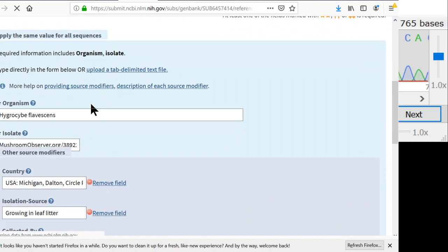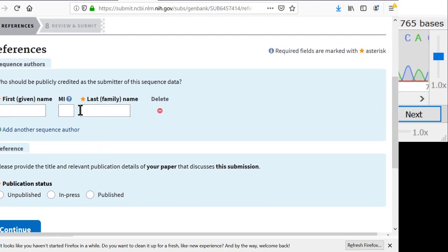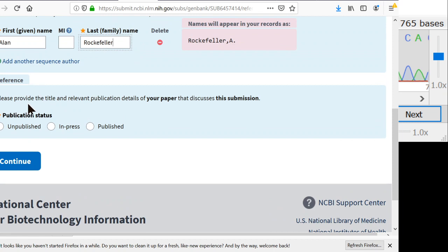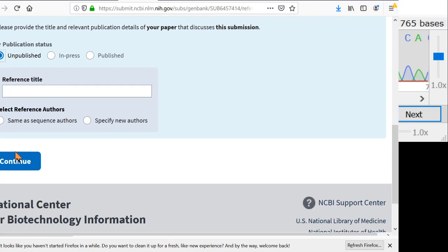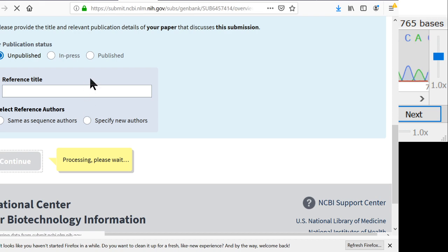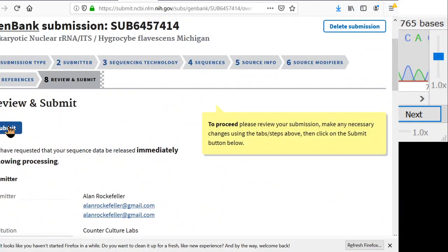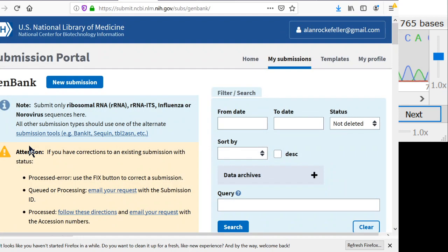And now here we get to put in a little bit more information about who actually generated the sequence. And a lot of times people submit sequences to go along with a scientific paper. But it's really important to submit all your sequences to GenBank just to make more data available to other people that are working on these things. So I submitted a lot of sequences that do not go with a paper. So we just say unpublished, and then you can just leave this stuff blank and hit continue. And now we just look it over, see if everything looks reasonable, which it does, and click submit. So now this sequence has been submitted, and in one week it'll go live, and if anybody else finds the same mushroom, they will be able to see that I found it in Dalton, Michigan.